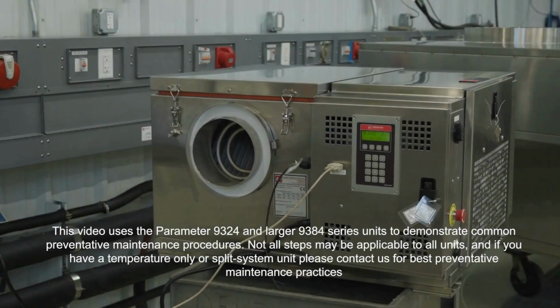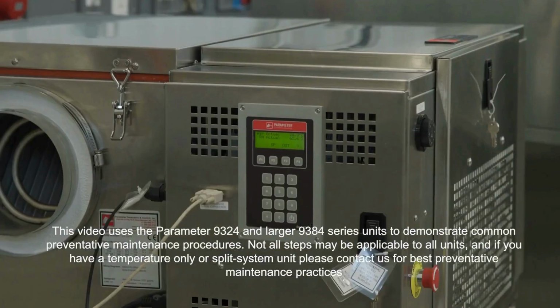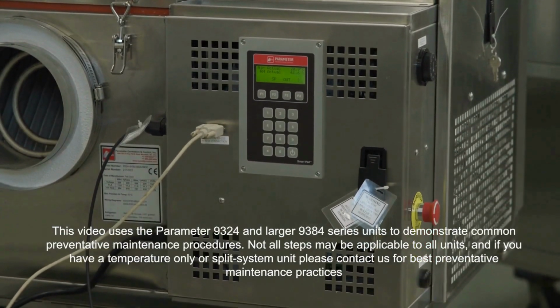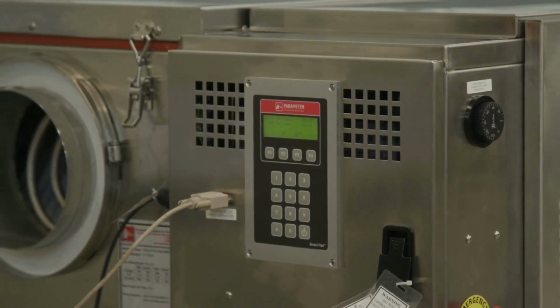This video will take you through common preventative maintenance procedures for parameter conditioning units. Here we'll cover basic verifications, in-depth technical inspection processes, cleaning and periodic maintenance procedures.